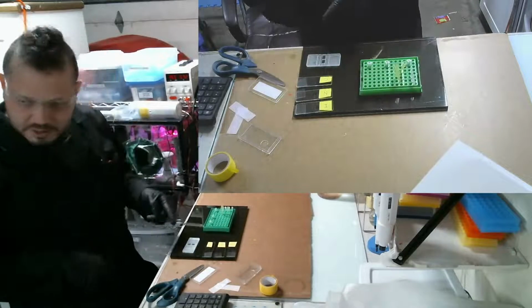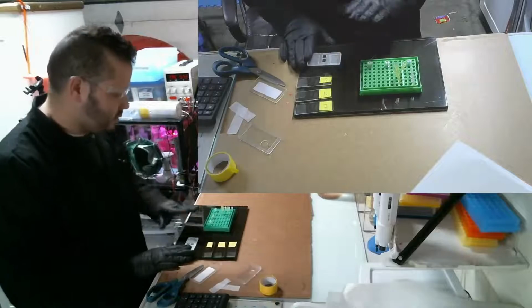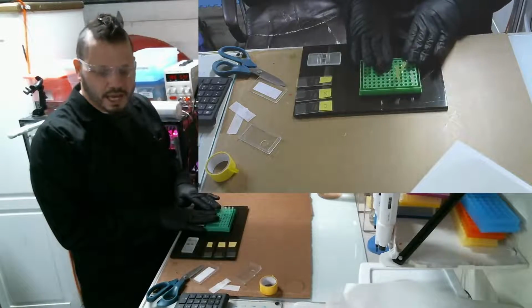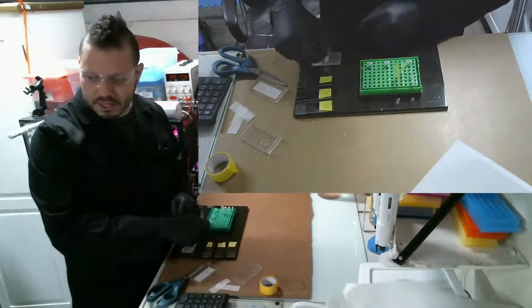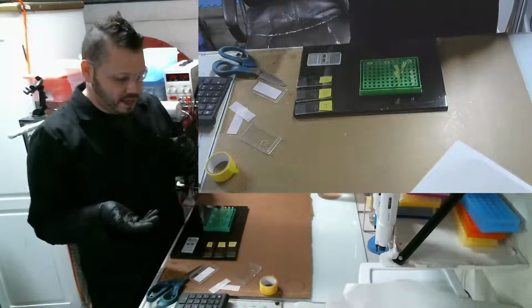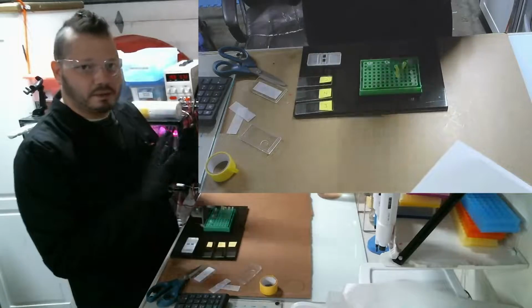And what I'm going to do is a hemocytometer count of each one of them, and I'm going to record that count of each. Then I'm going to take some more sample and put it on these three slides, and then I'm going to do some measurements and some observations of the changes to the algae.